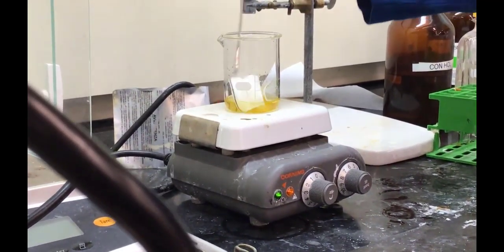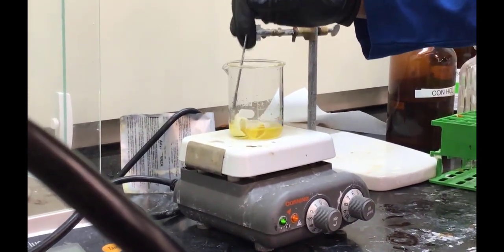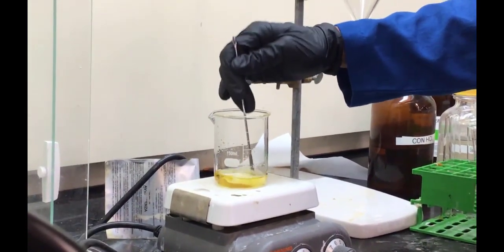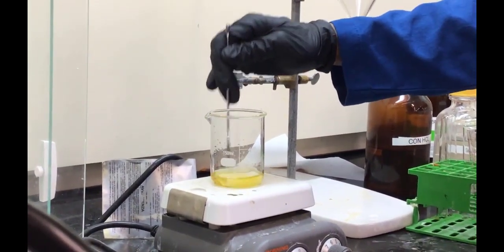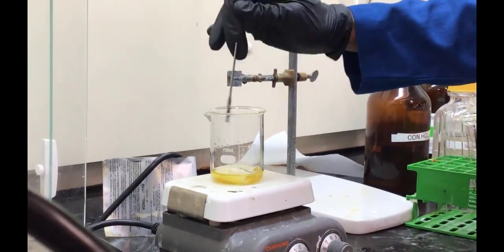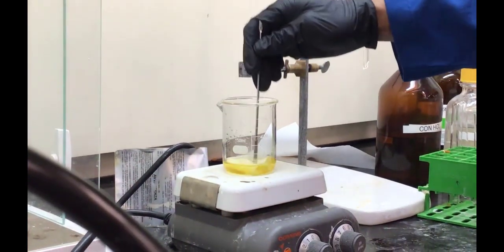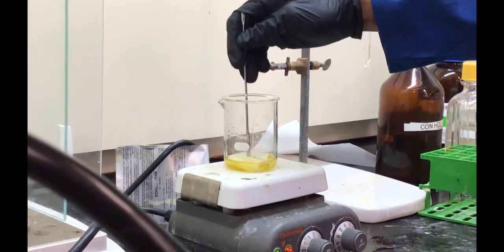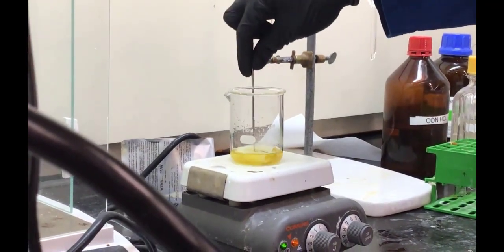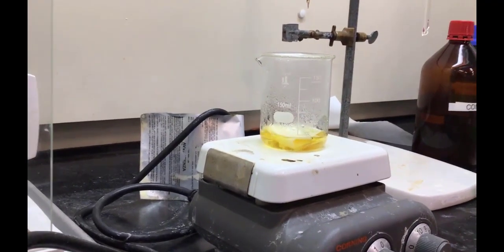Now they're adding cloth fabric. They're going to use the azo compound with the cloth fabric. They're going to stain that fabric, so it's going to go from looking all white to now having certain sections of it that are going to be stained distinctive colors. Right, and so they actually heat this up, keep it in there long enough, and actually get the solution to boiling so that they can adequately stain the fabric. There it is boiling.